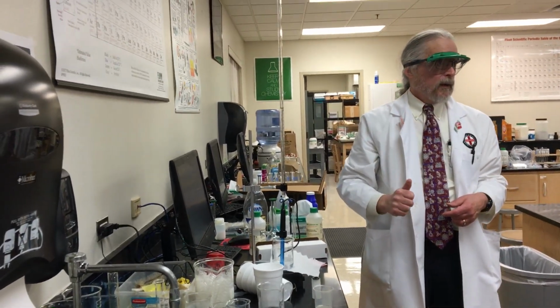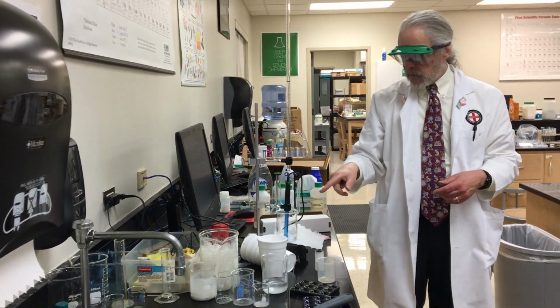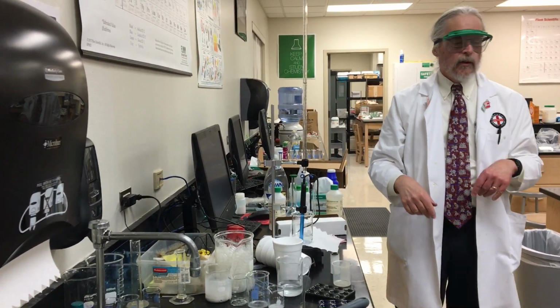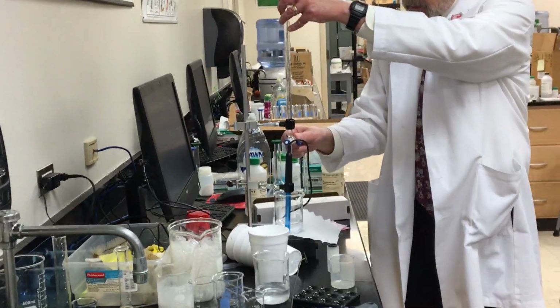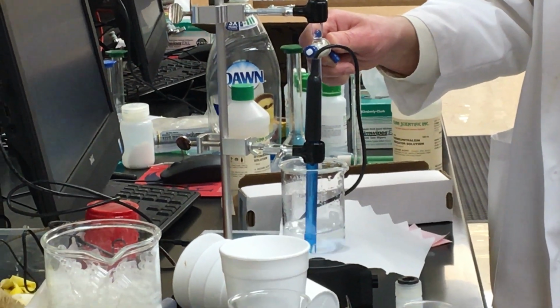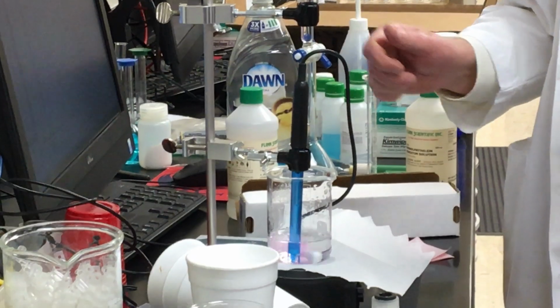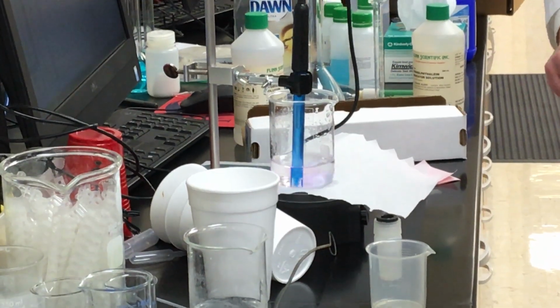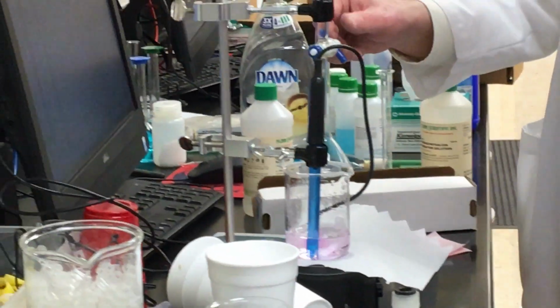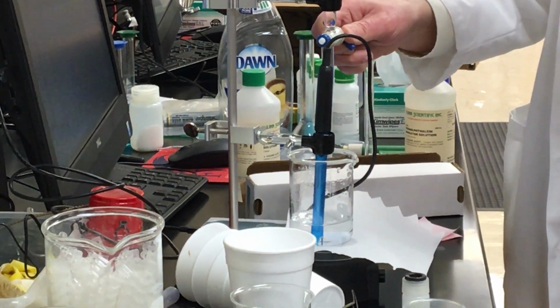Slow it down. So you can have it kind of go in a fast drip, drip, drip, drip, but when you start seeing that color, slow it down. Now, as we go, I'm going to let it just drip like that. Notice it's lasting longer with every drop.